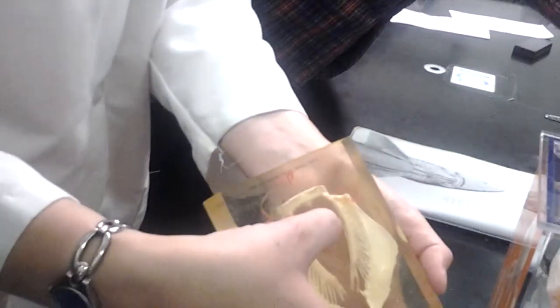What are these little bumps at the end? Iliac processes. The iliac processes are on either side of the pubo-ischiac bar. Now, what's this long structure here? It's a basal, right? There are two basals on the pelvic fin. And the metapterygium is this whole long thing here.